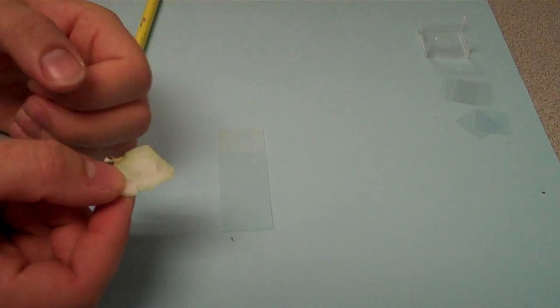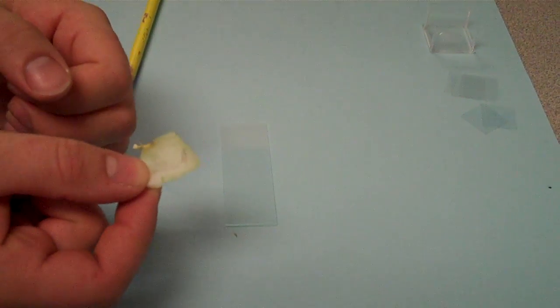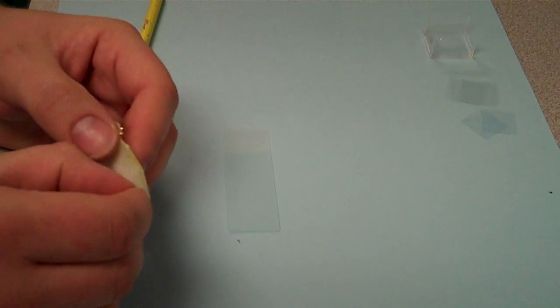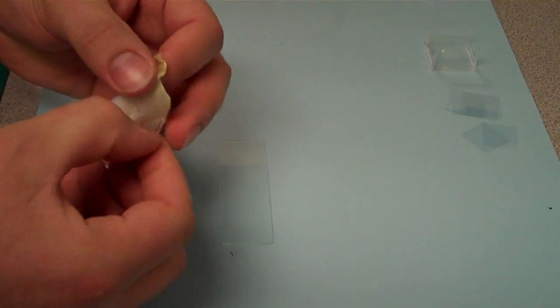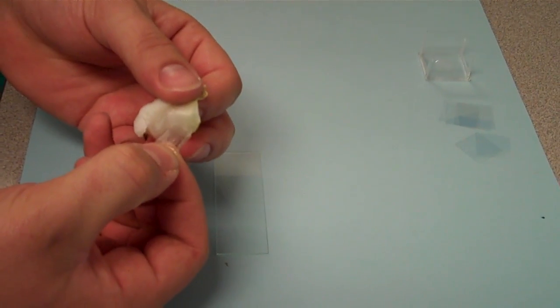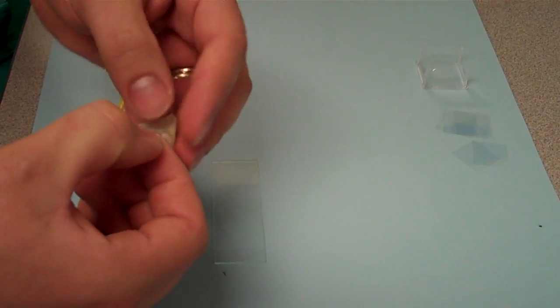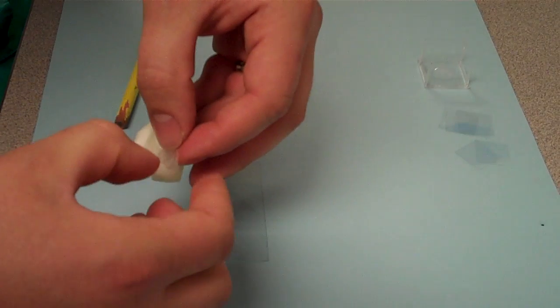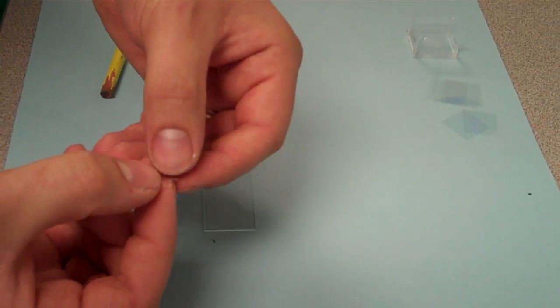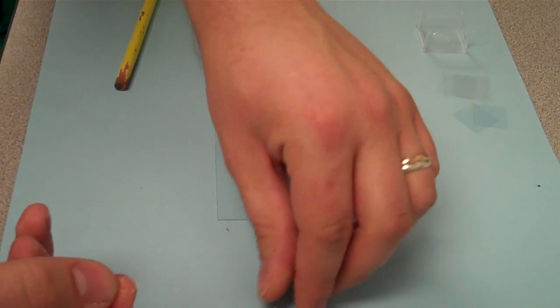So the first thing is you need to get a piece of sample, now that's obviously way too thick. So we're just going to take a small piece of this membrane, so it's a thin transparent film that you'll find probably on the inner layer of the onion, of one of the layers. So we just break a small piece, now you really don't need a large piece, even that's probably too big, so I'm just going to break that in half.